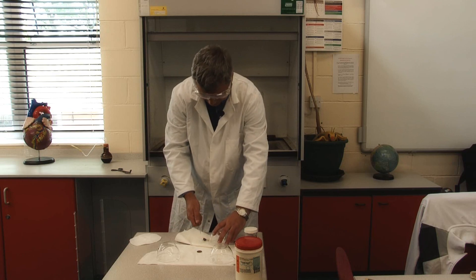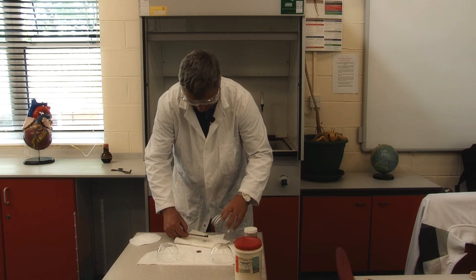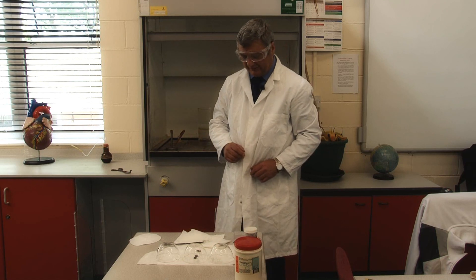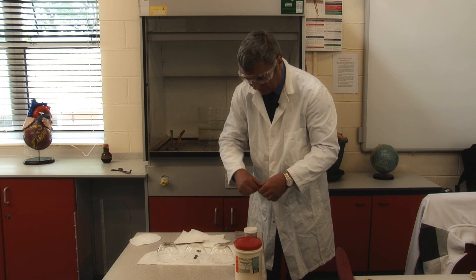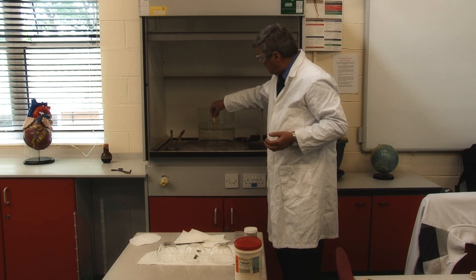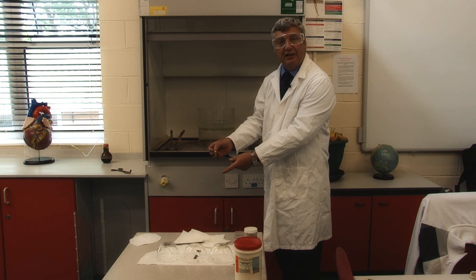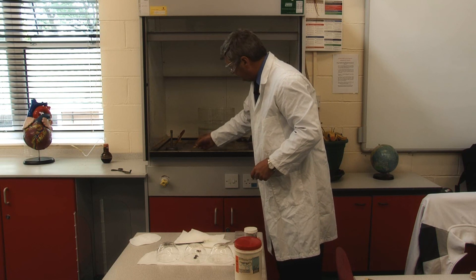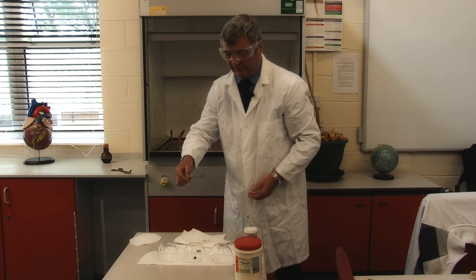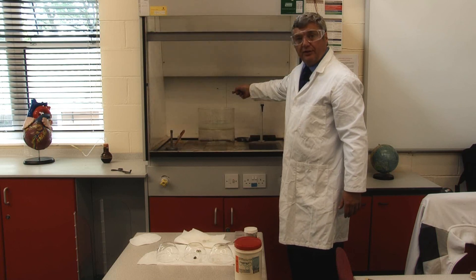This piece is probably big enough for two demonstrations, so we cut it in half. The pieces that you've cut can be placed underneath the container. Before we add it to the trough of water, we can demonstrate that the water is neutral to start with, with a pH of 7 and green with the indicator. Once you've demonstrated that, take a piece of the lithium, making sure the fume cupboard is switched on.